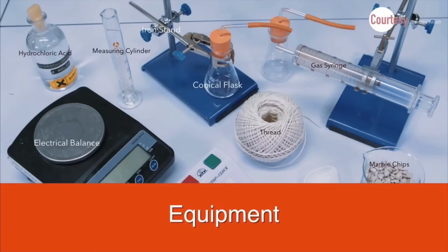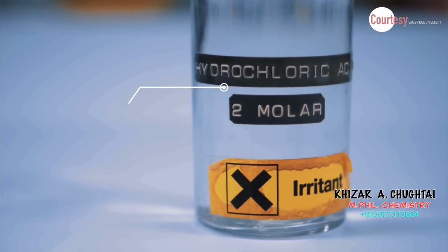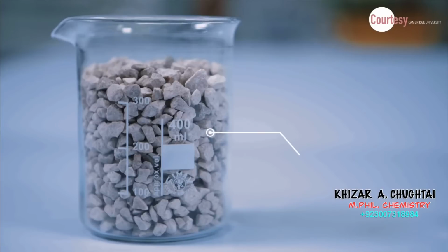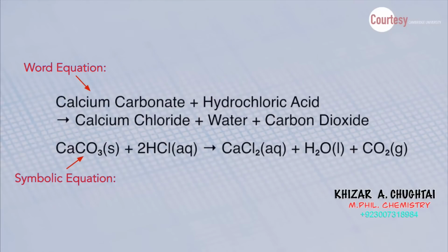In this experiment, we will determine how the concentration of hydrochloric acid affects the rate of a chemical reaction. Various concentrations of hydrochloric acid will be used with calcium carbonate, which is also known as marble chips. Calcium carbonate reacts with hydrochloric acid, making salt, calcium chloride, and water, H2O, and carbon dioxide, CO2. The volume of gas released and the time will be followed in this experiment.